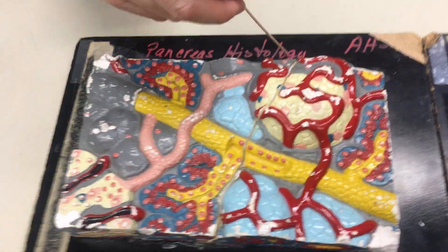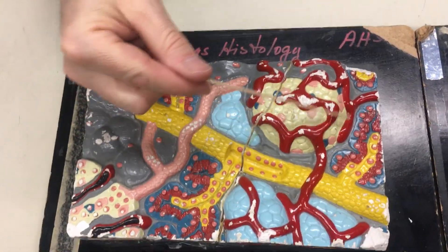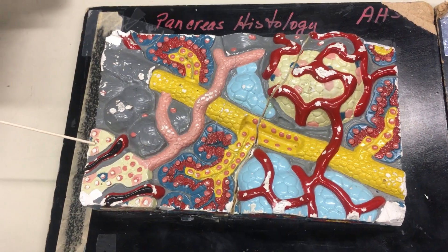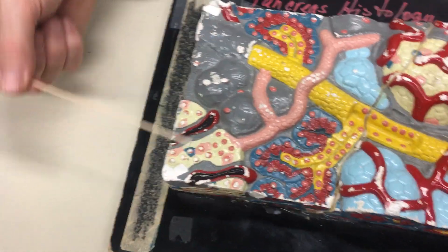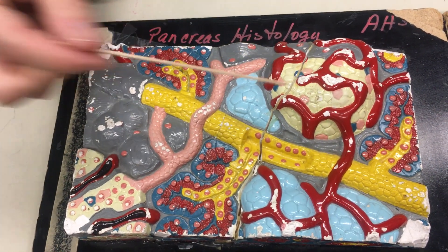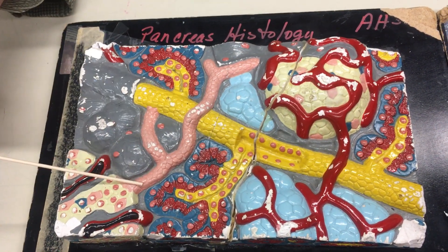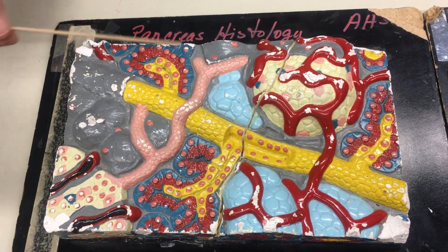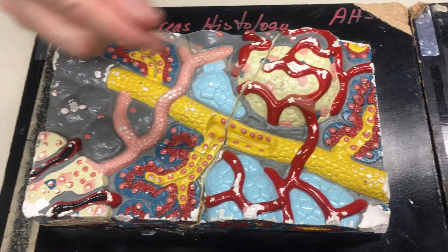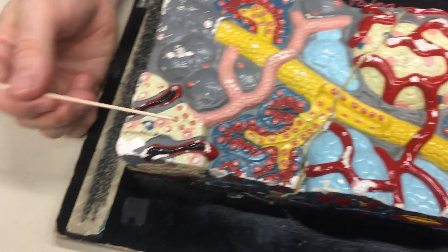Now for the pancreas histology. This is a pancreatic islet — here's one cut open to show some of the cells, and here's one as a more solid unit. The pancreatic islet is the endocrine portion of the pancreas. The rest of the tissue is the exocrine portion. Here you can see capillaries surrounding the endocrine cells.